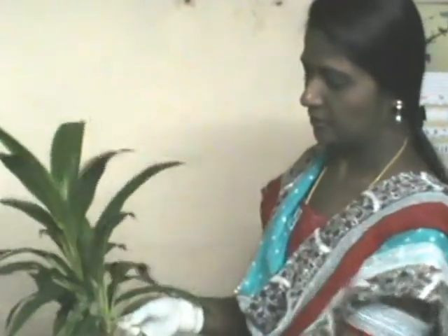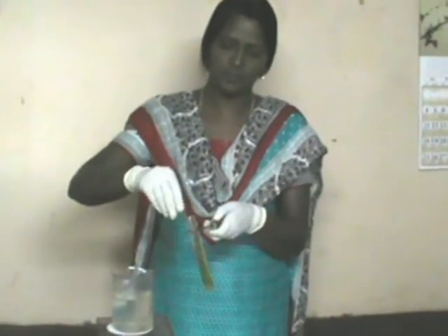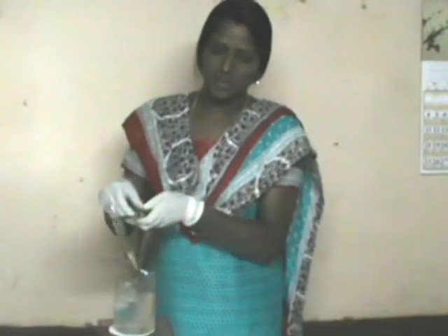After six hours, pluck the leaf from the plant. Take a beaker and half fill it with water. Take a test tube and place the leaf inside the test tube. Keep the test tube in the beaker and boil to denature the enzymes.